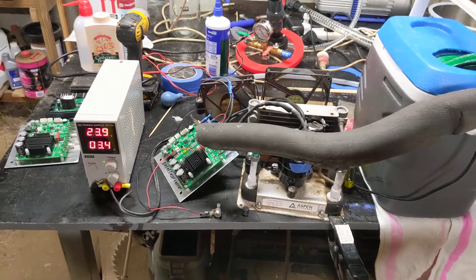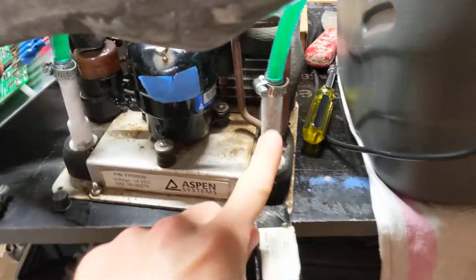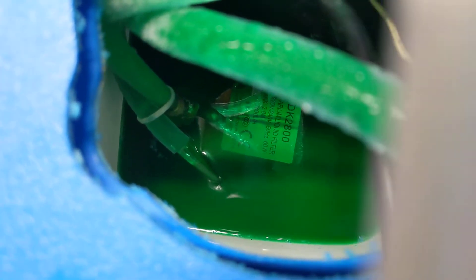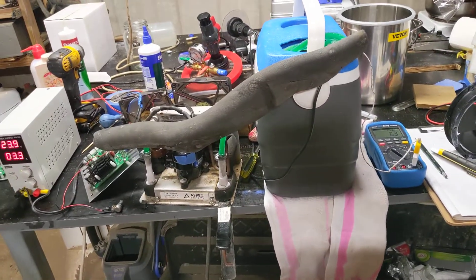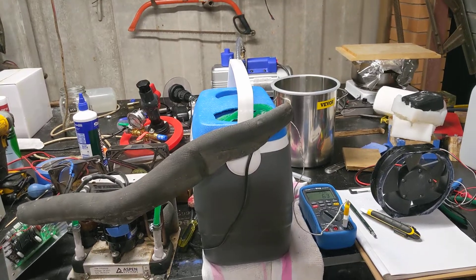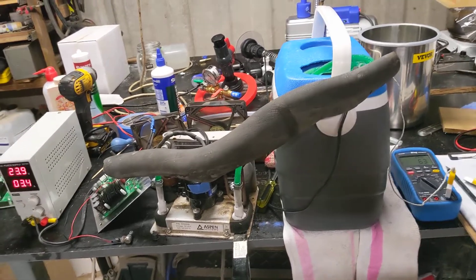It's been running for about two hours now and we've got some ice forming on the pipes. It's down to negative 6.2. The pump in there is still pumping — I pulled the outlet up above the coolant level so I can see it moving. This has taken ages. It seems there are diminishing returns: the colder it gets, the less quickly it's able to pump heat out of the coolant.